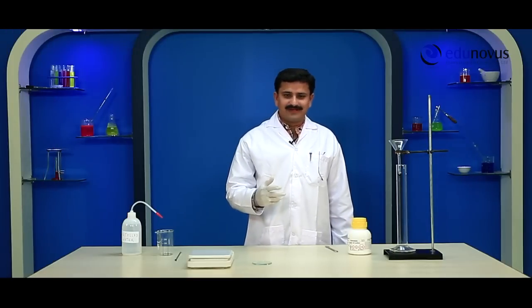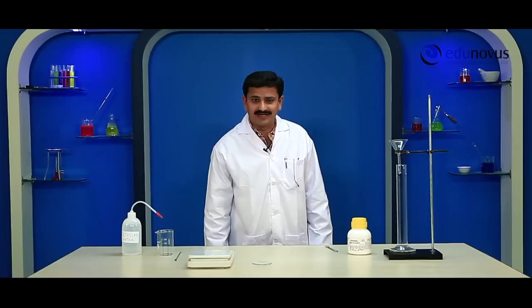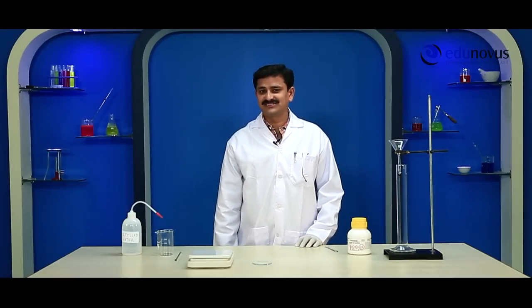Before starting the experiment we need to determine the amount of oxalic acid crystals required for the preparation of 250 ml of 0.1 molar oxalic acid solution.